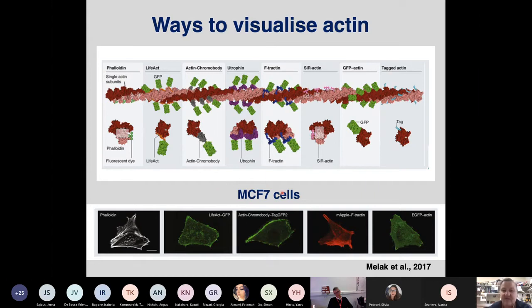MCF7 cells, which is some crap cell line that, it's not a cardiomyocyte. So as far as I'm concerned, it's an inferior cell line. But just when you compare what you visualize with the different actin visualization tools, it becomes quite apparent that you're actually looking at different populations of the actin.